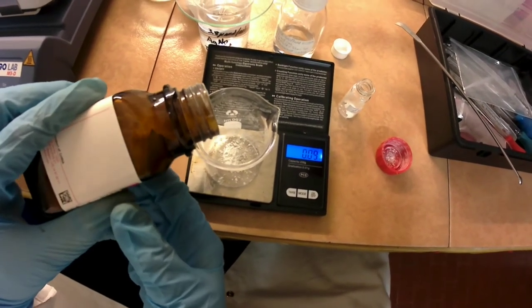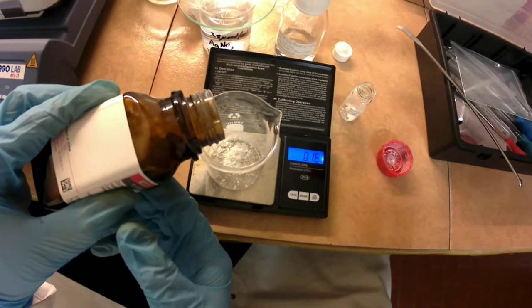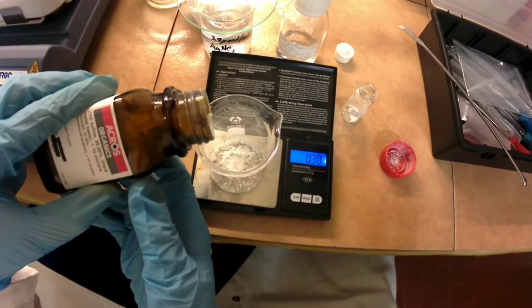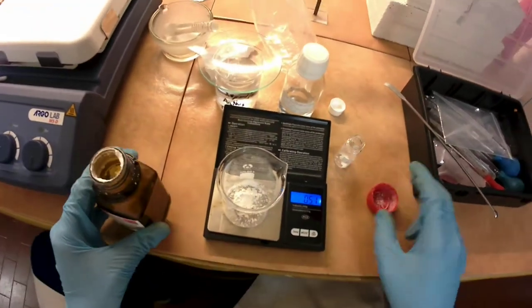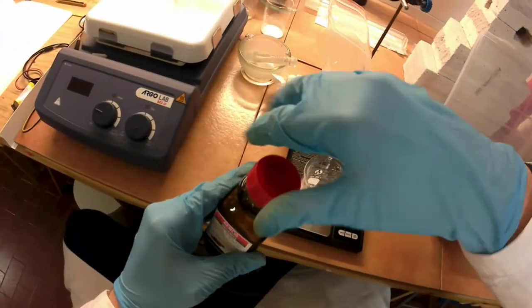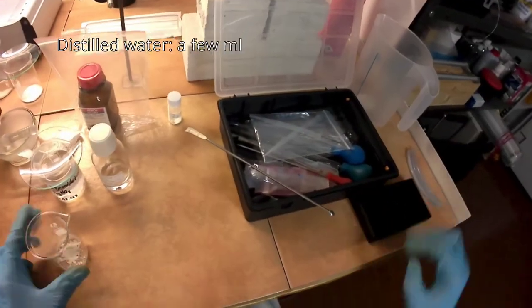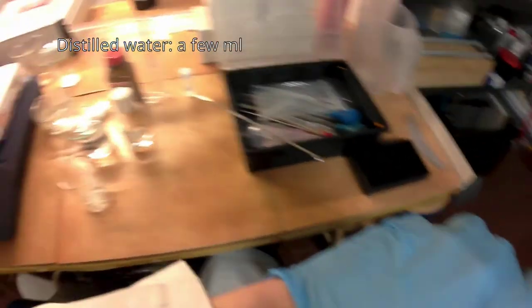It is possible to synthesize it yourself, but the procedure is dangerous. I am pouring the desired amount by rotating the container instead of using a spatula so as not to introduce impurities in the container that may accumulate. After that, a few milliliters of water is added and the beaker is agitated.